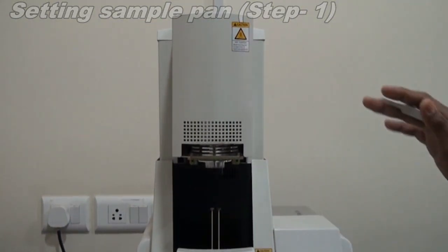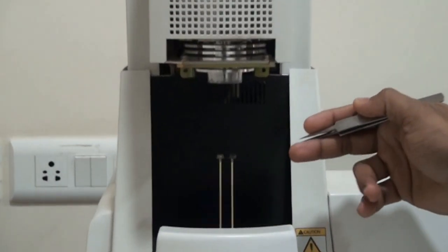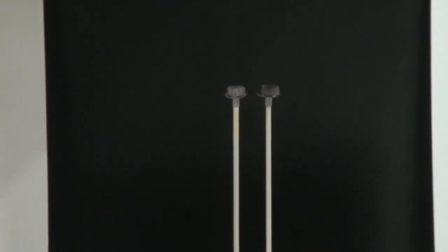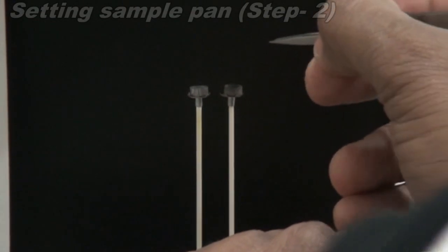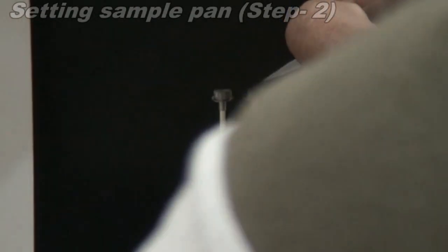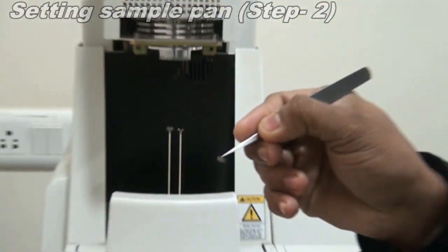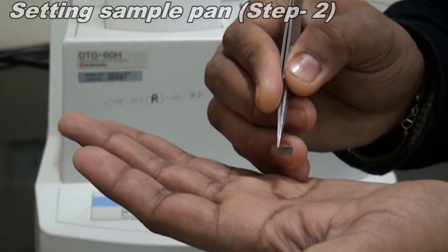The furnace is now completely open. This is my sample pan, which is kept on the RH side, your right hand side. I am just taking it out. For taking out the sample pan there are steps you need to follow. You need to keep your hand like this to give support while taking out the sample pan. You have to take it like this. Okay. After taking the sample pan, you need to go to the weighing machine.